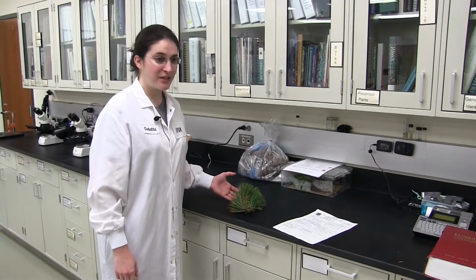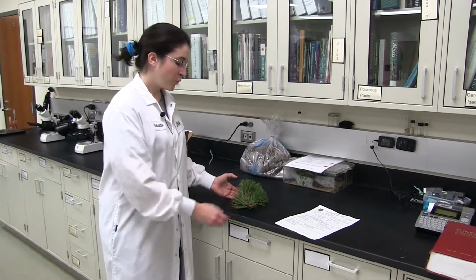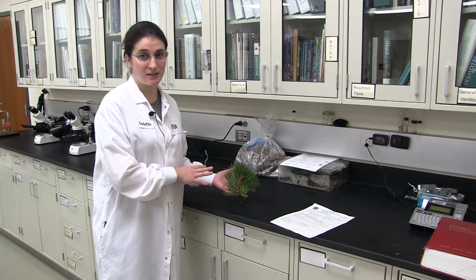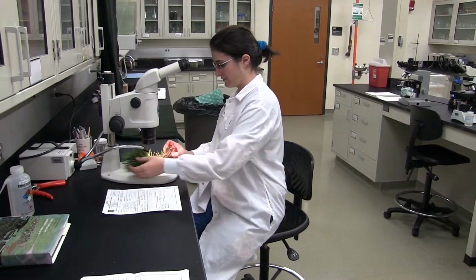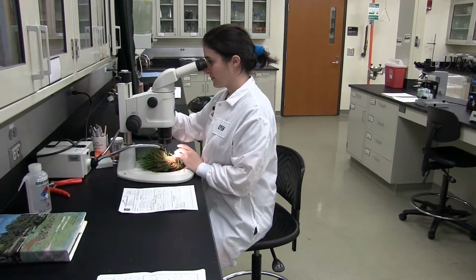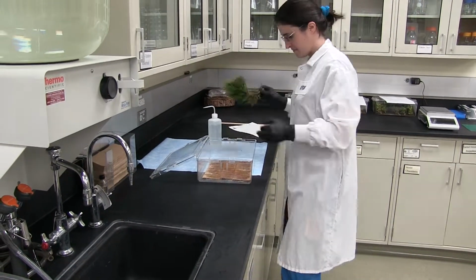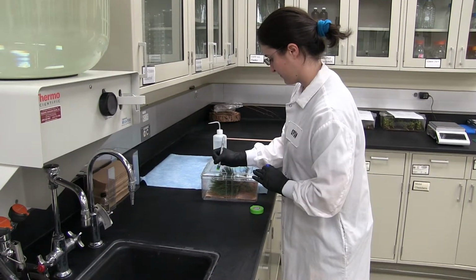So we bring the sample into our main lab for our initial look at the plant sample. We're going to look to see if there's any fungi, bacteria, or insects present on the plant. We'll take it to a microscope to look at the sample, and if we assess that it needs more, then we'll continue on with the sample into the process. We have moist chambers, culturing, and further testing as needed.